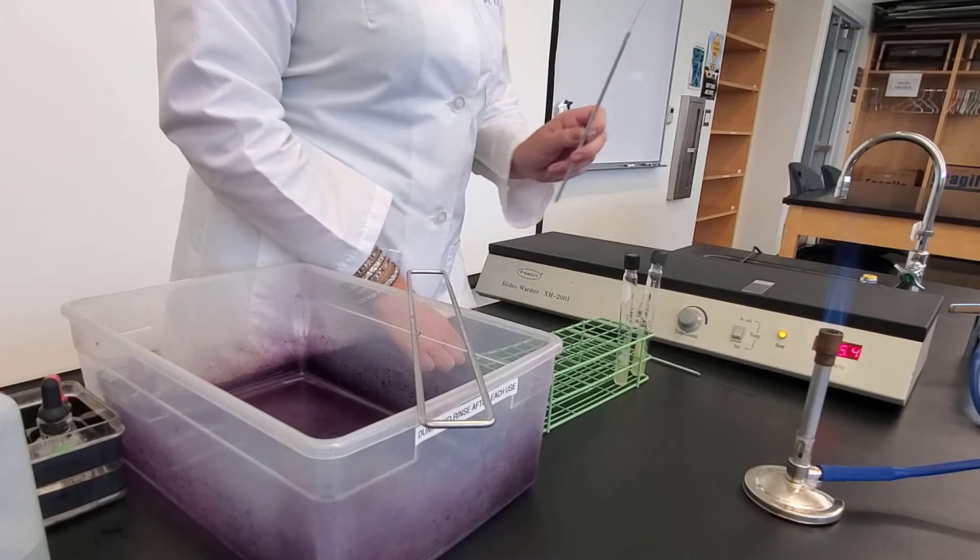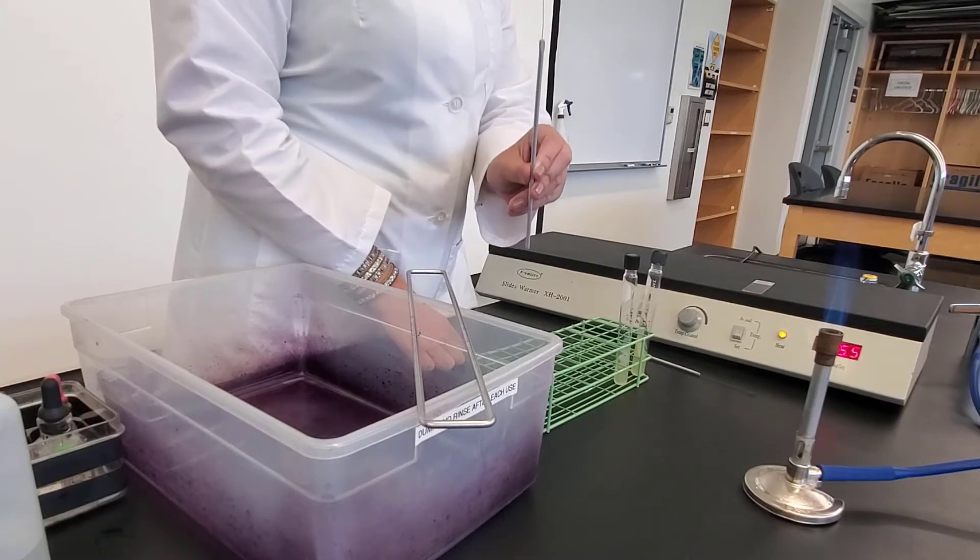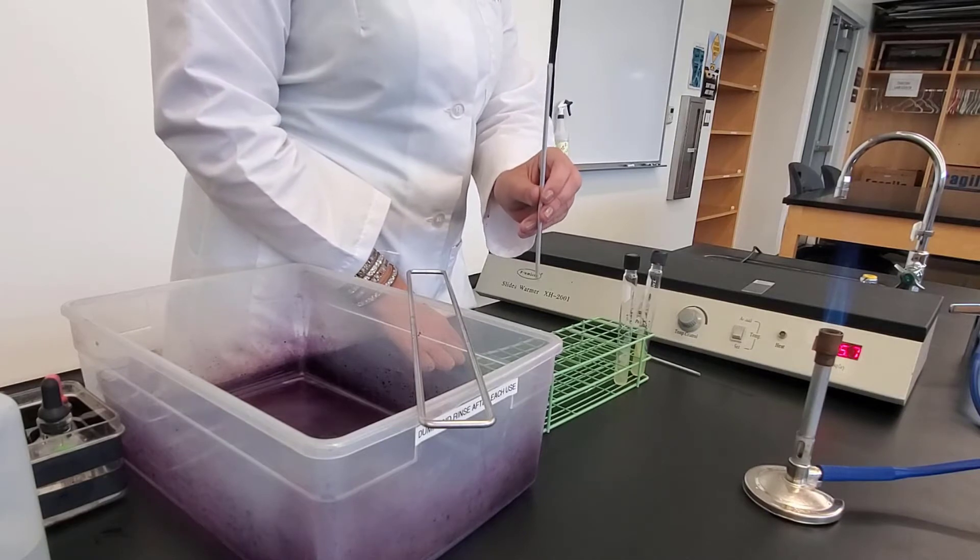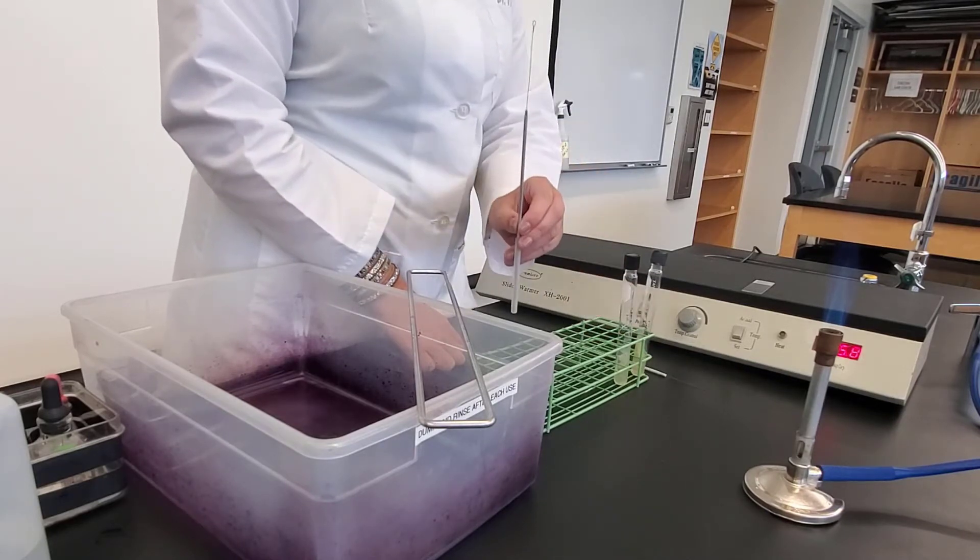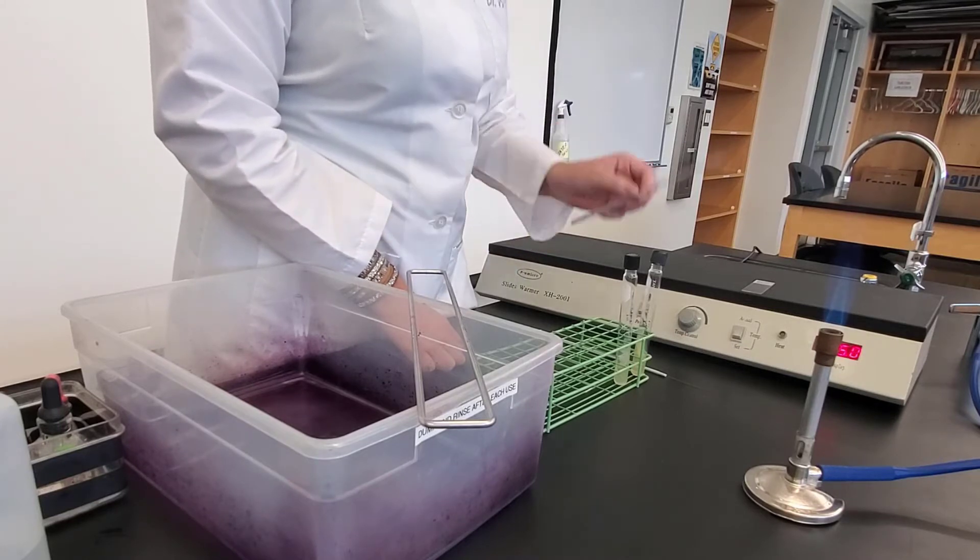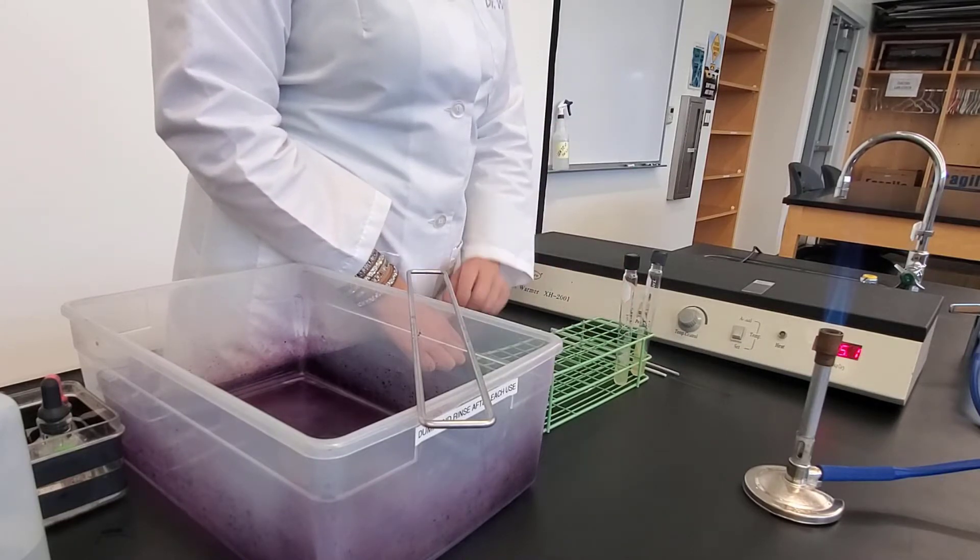Now, the reason I had to use my needle to add the bacteria is because we want to use the needle so that we don't pick up too much bacteria. If I were to use my loop to pick up the bacteria, I would pick up way too much. So instead, when I transfer bacteria, I use my needle.